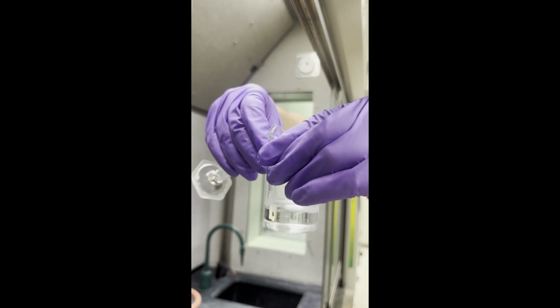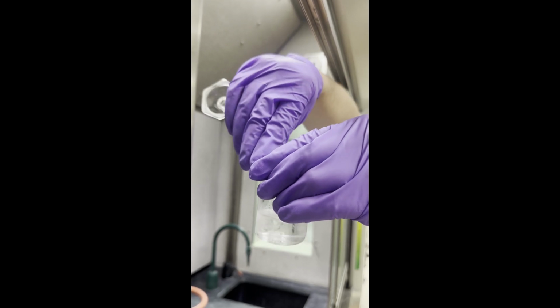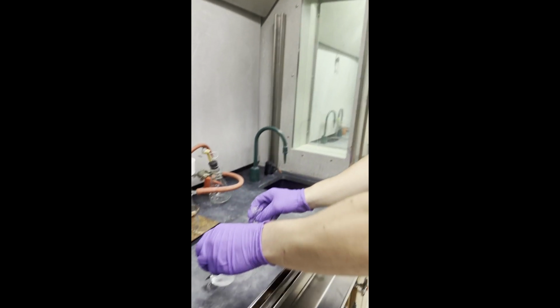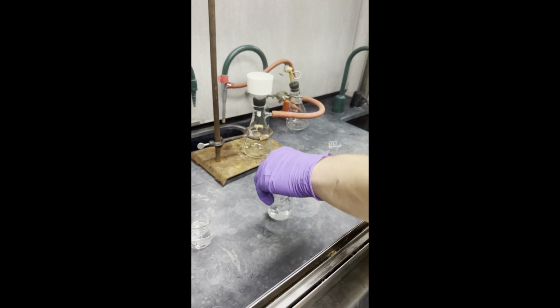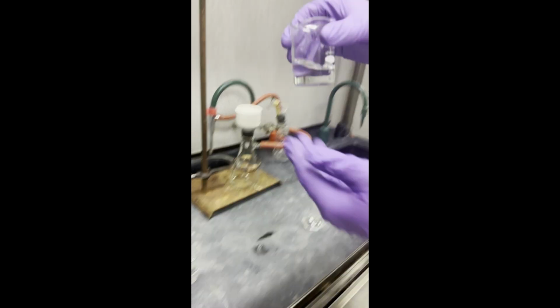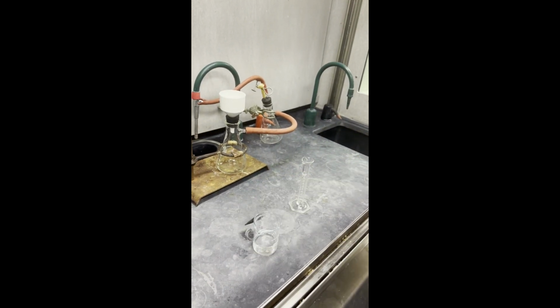Here we go, we're starting to precipitate, and we're going to add the last little bit of hydrochloric acid.